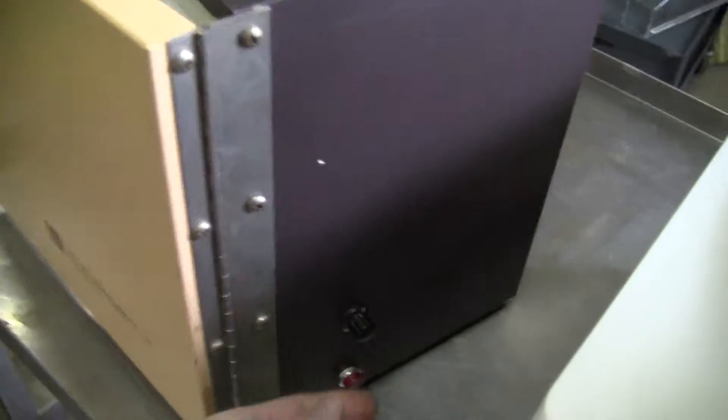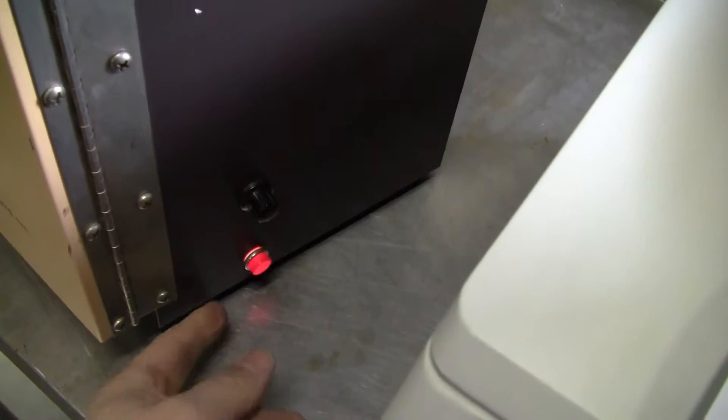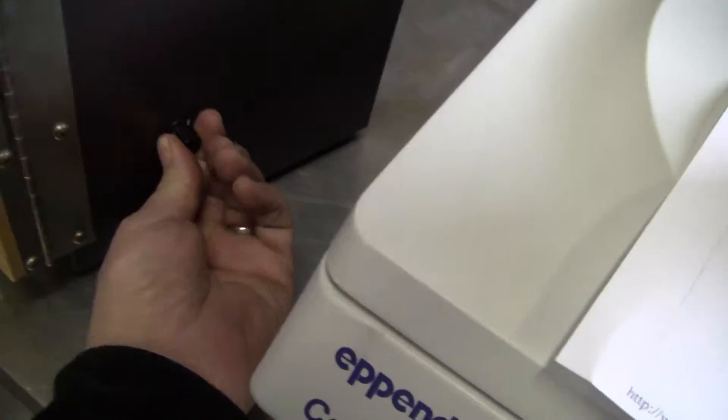The controls for this particular unit are on your right. By turning the dial you'll increase the temperature, looking for the red light to come on. Decreasing it will turn it off, lowering the set point temperature, like that.